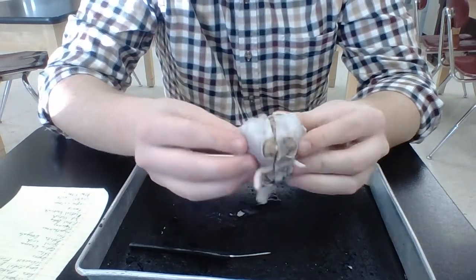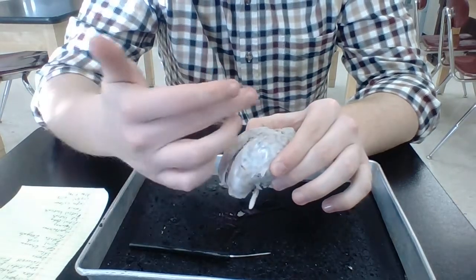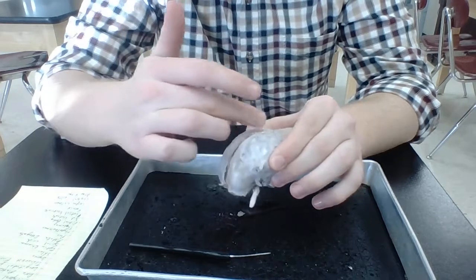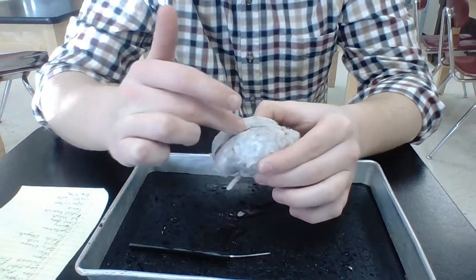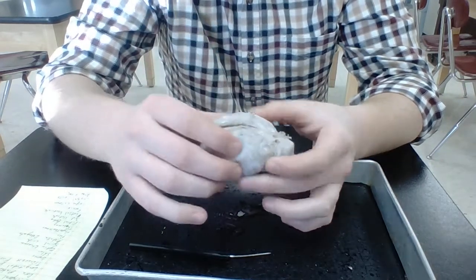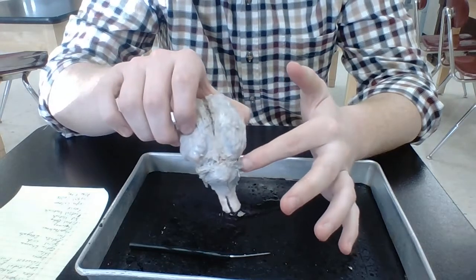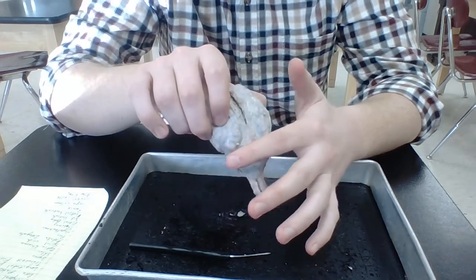So also, looking at the outside of the brain, you have a couple of different fissures that we're going to look at. So fissures are these giant grooves. So you have your longitudinal fissure, which splits the cerebrum into two hemispheres. So this is the longitudinal. Then you also have your transverse fissure. That goes from right here, and that splits the cerebrum from the cerebellum. That's right there. All right.